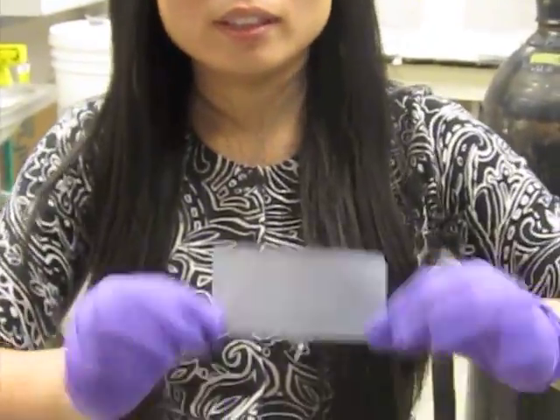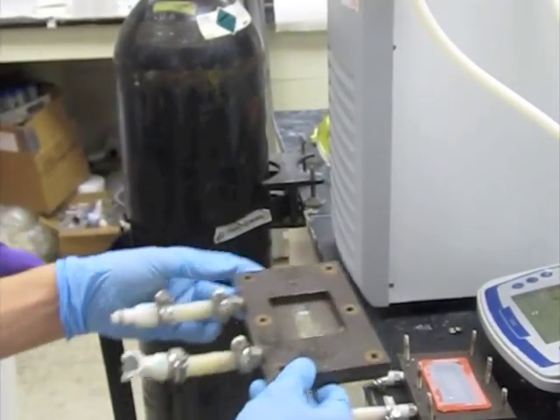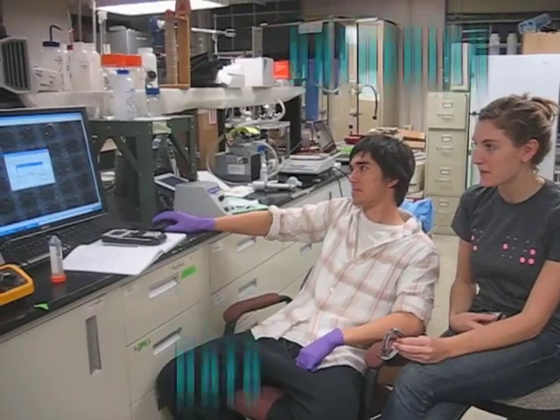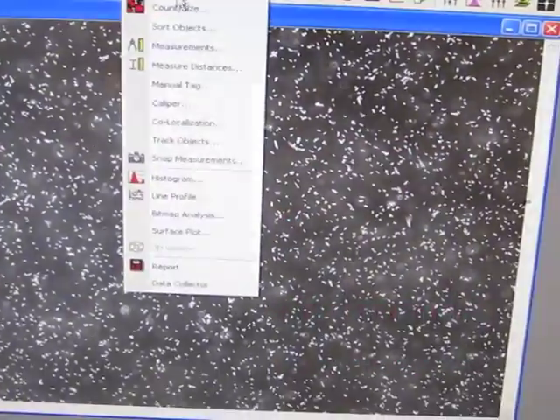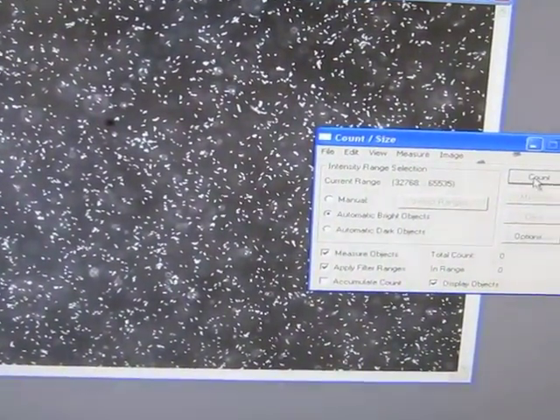Finally, the experiment can actually begin. We put the new membrane, feed, and draw solution in the apparatus and turned on the pumps. Then we captured one image with the microscope every minute for 45 minutes, and then every 5 minutes until we reached 1 hour.